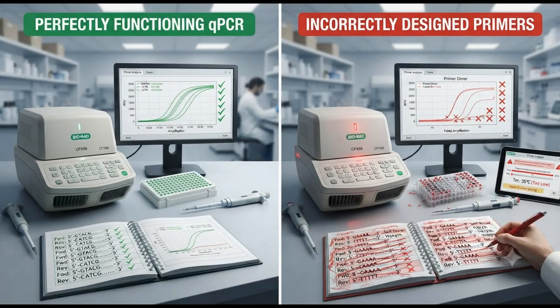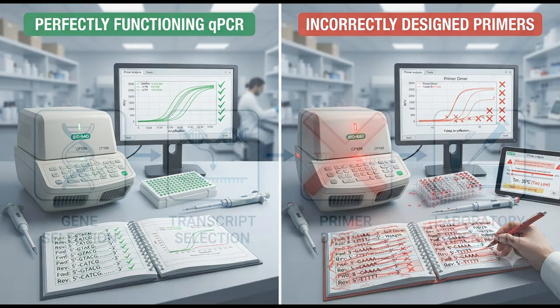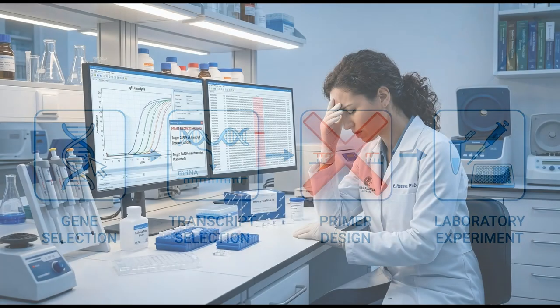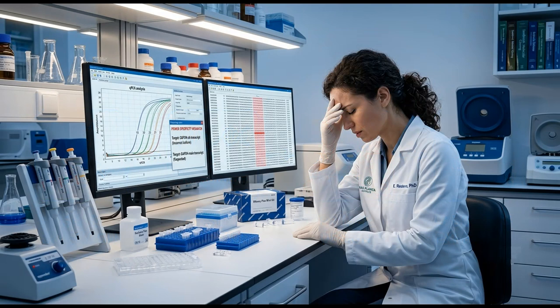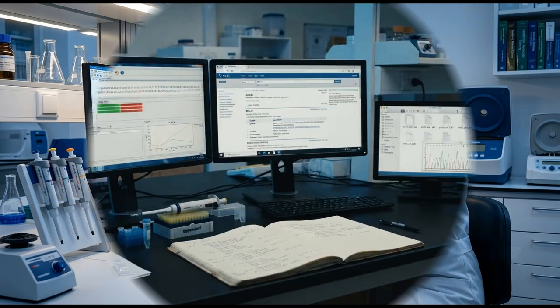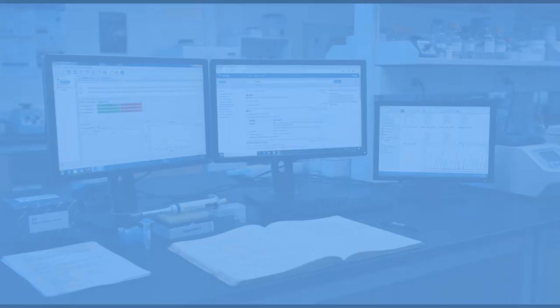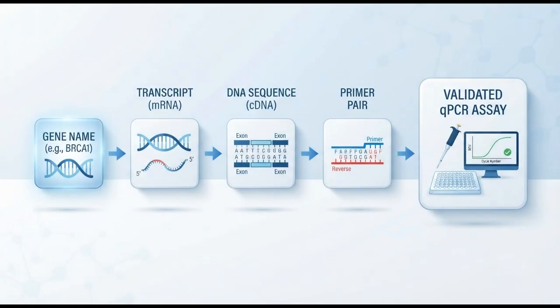Not because qPCR is unreliable, not because the software made a mistake, but because the assay was designed incorrectly before anyone entered the laboratory. The good news: almost every one of these mistakes is preventable. In this tutorial, I'll show you exactly how I design qPCR primers from scratch using completely free online tools. We'll start with nothing more than a gene name and end with a fully validated primer pair ready for ordering.